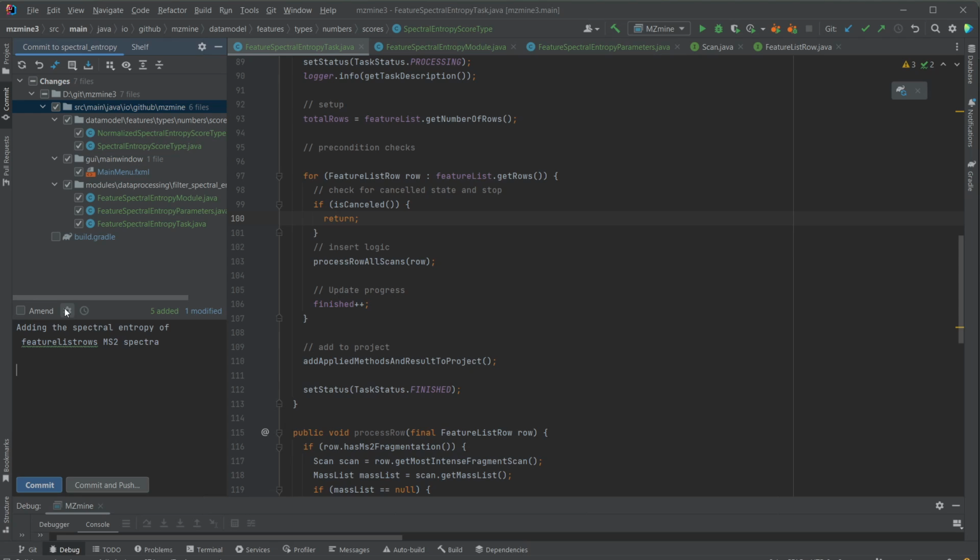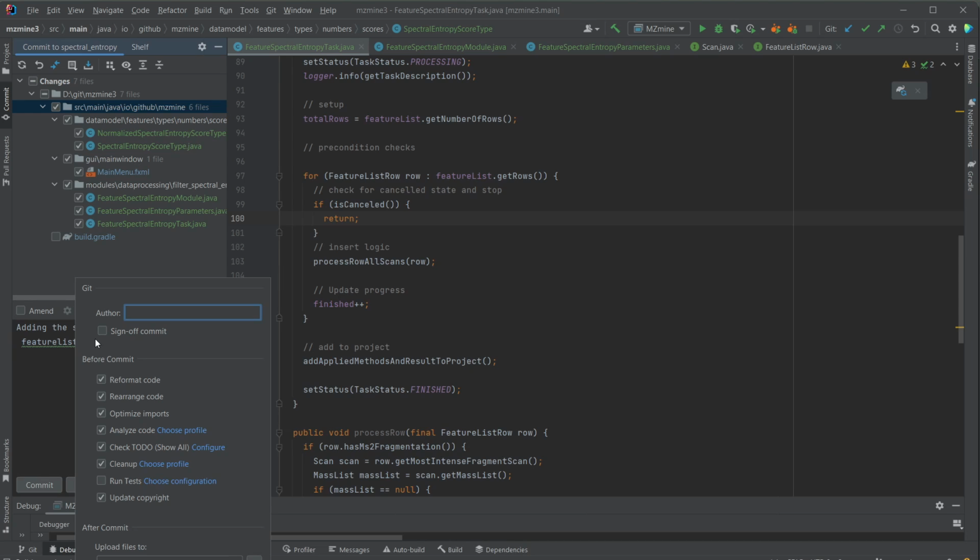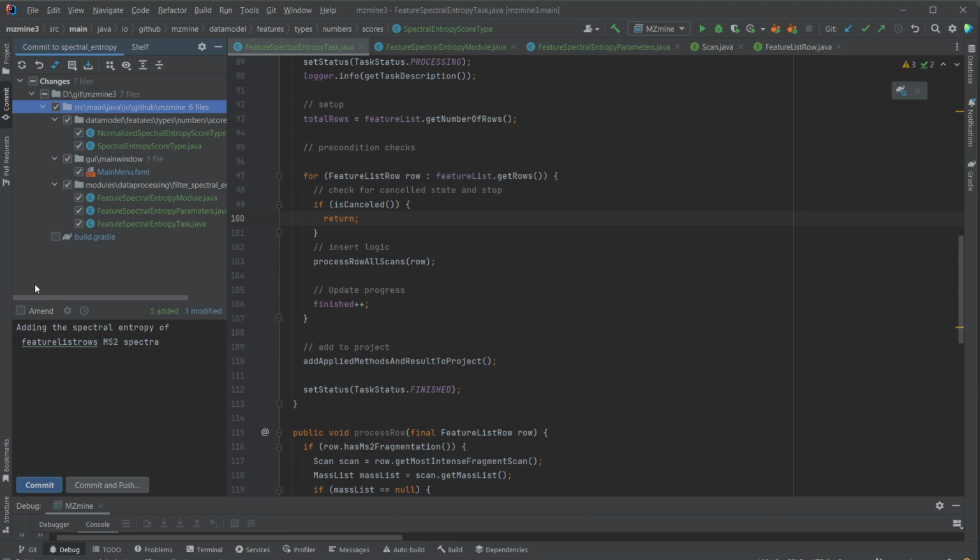One very nice option in IntelliJ is that here we have the commit options, and typically I run most of these. So we have the reformat code. I do use the format from MZmine. We have the rearrange, optimize imports, analyze code, and then check some cleanup and update the copyright. So there should be a copyright over each of the Java files that you commit, and also other files. And that's done automatically in those settings.